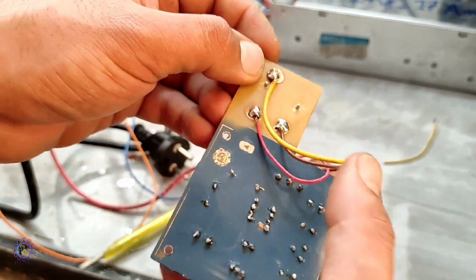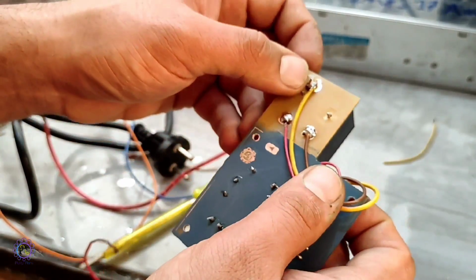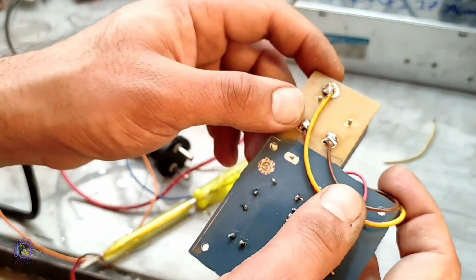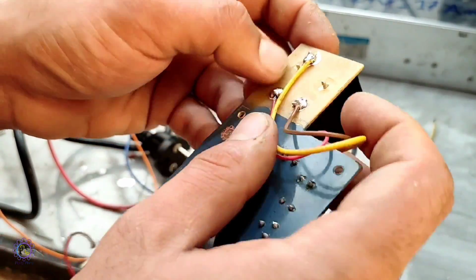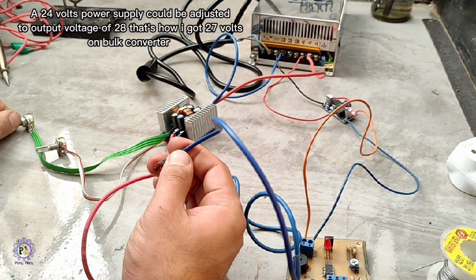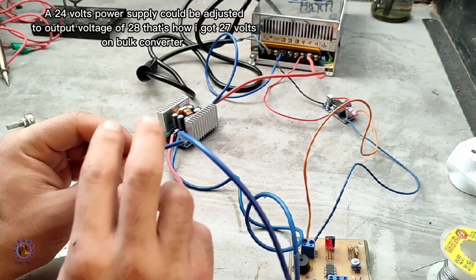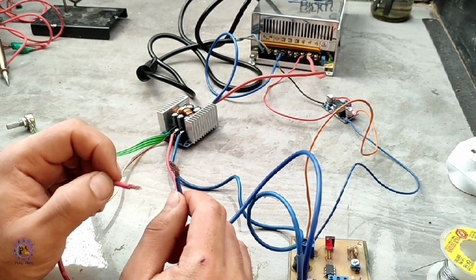Afterwards, all components were soldered on the PCB, comprising the LM358 op-amp IC as a main component. I use a transistor and relay system. Of course you can use a MOSFET in your design, but this design actually fits my needs. Next I hooked up the whole circuit to test the short circuit protection that I designed. Spark here, but it disconnects the output.